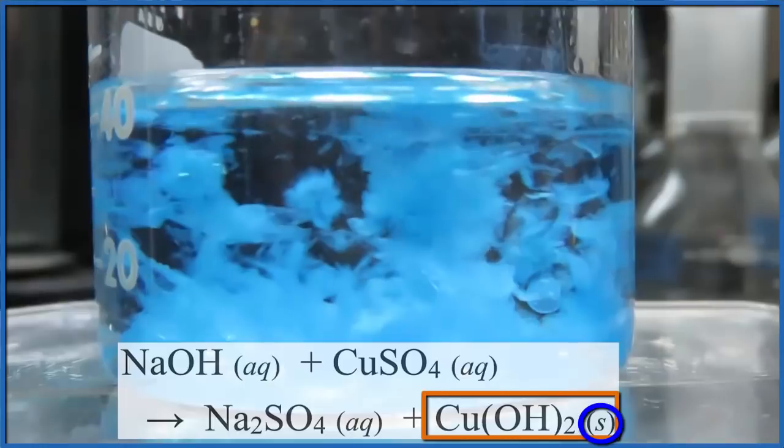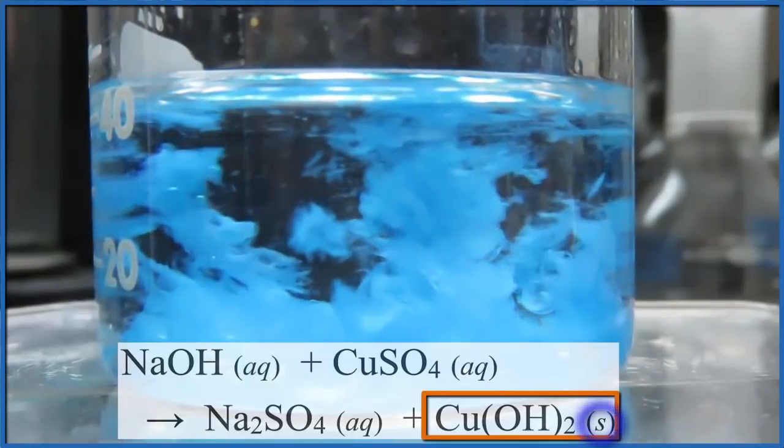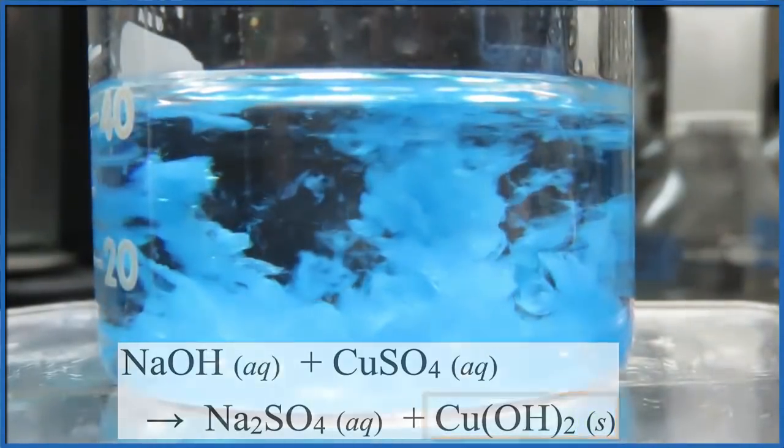But that solid, that Cu(OH)2, that's the copper hydroxide, and that's the precipitate.